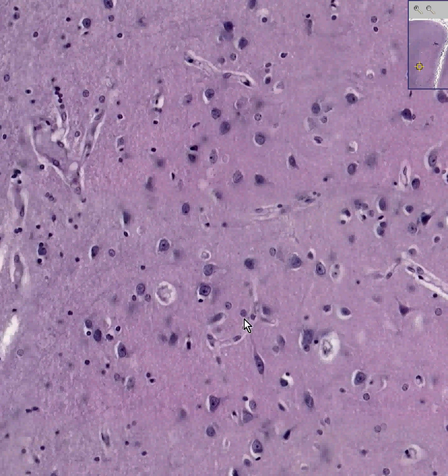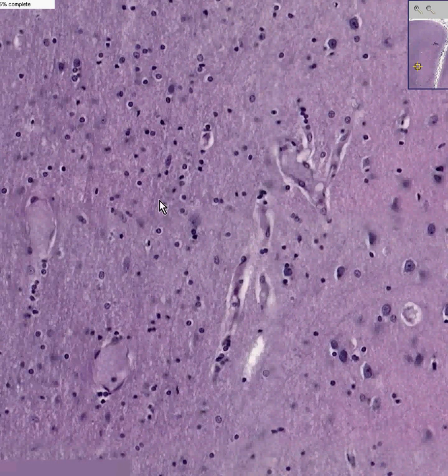And so they may have a nucleus that looks a lot like an oligodendrocyte, but in their location next to a blood vessel where there's neurons present, these small round nuclei, perhaps here, are much more likely to be astrocytes. Whereas when you see a cell like perhaps here, or certainly in the white matter here, which has a nice little halo around it, that's an oligodendrocyte.